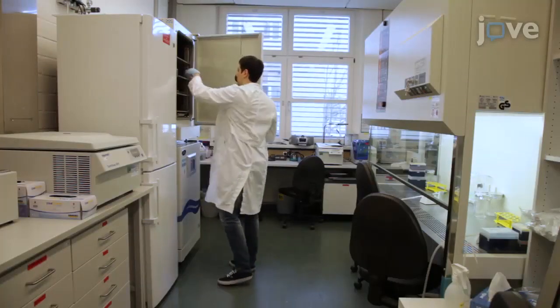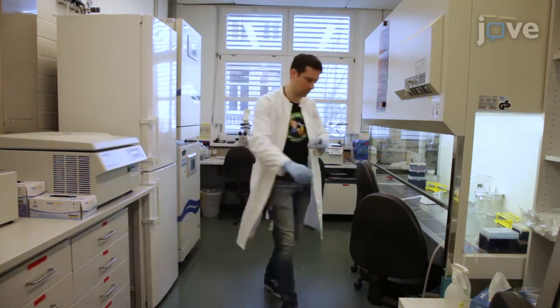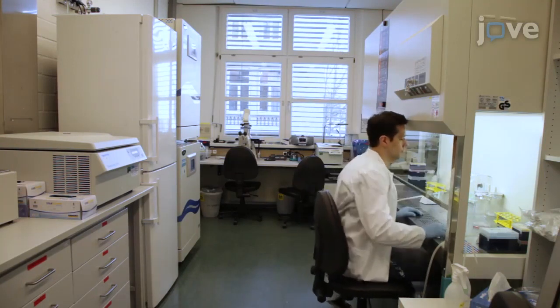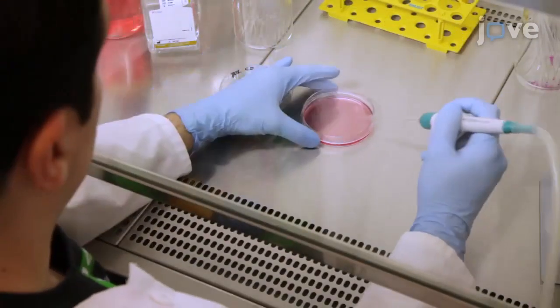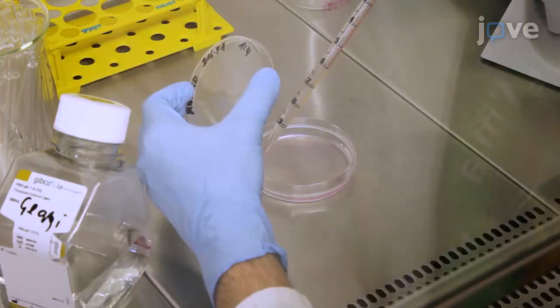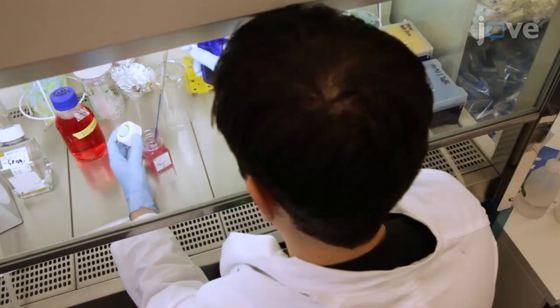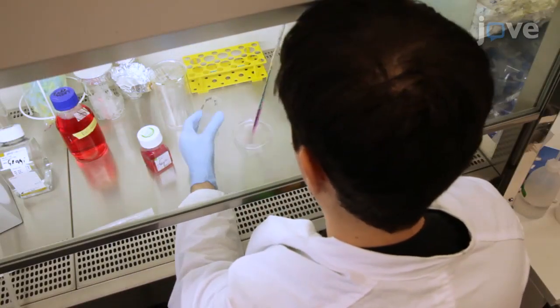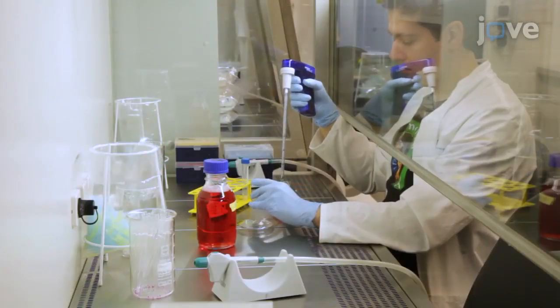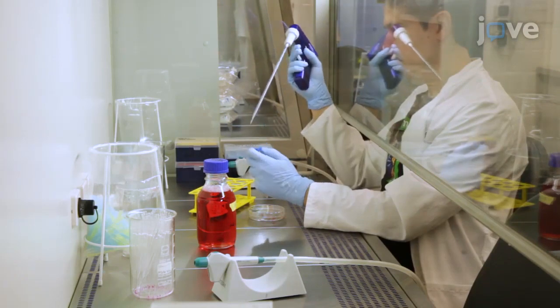To begin this procedure, passage previously grown B16F1 cells at a 1 to 5 ratio into a 3 cm plastic dish. Aspirate the cell culture medium, wash the cells with PBS, then aspirate the PBS and add trypsin EDTA to detach the cells. Add cell culture medium to the trypsinized cells, re-suspend and transfer the cells to falcon tubes.